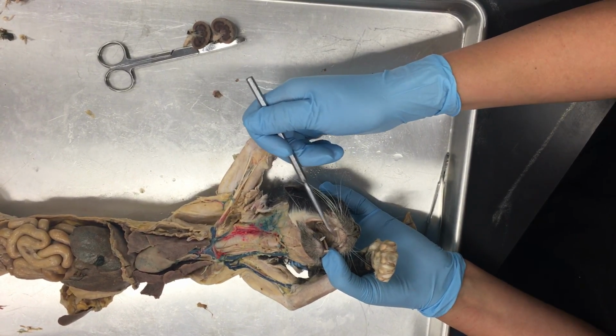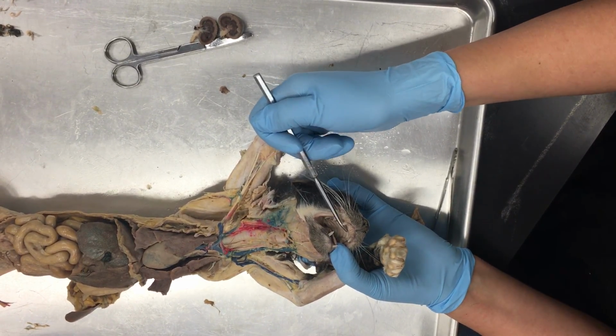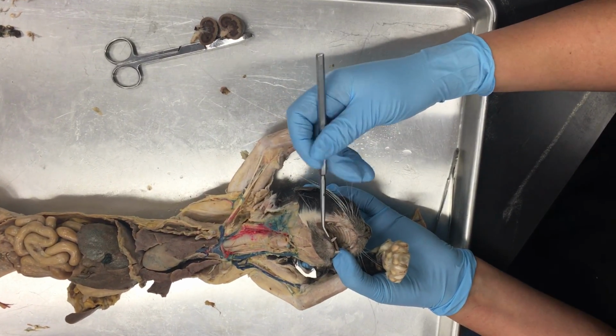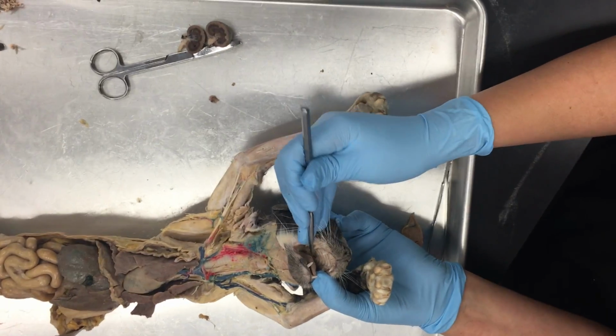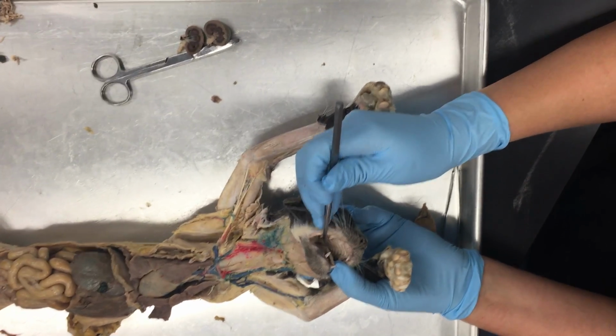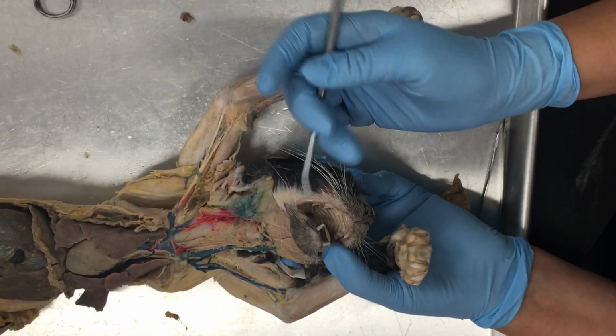Up towards the front teeth, there's this much sort of harder, bonier region. That's your hard palate. On people, if you make a t or a d sound, that's where your tongue's hitting the roof of your mouth. Back towards the throat, we have this much softer portion of the roof of the mouth. That's the soft palate. If you make a k or a g sound, where your tongue hits the roof of your mouth, that's your soft palate.